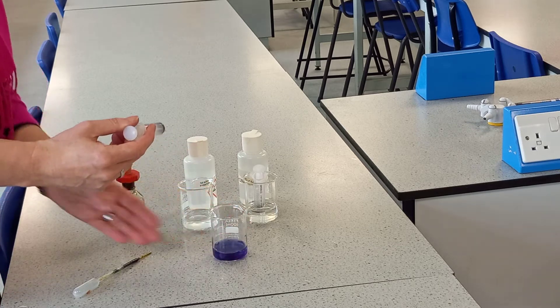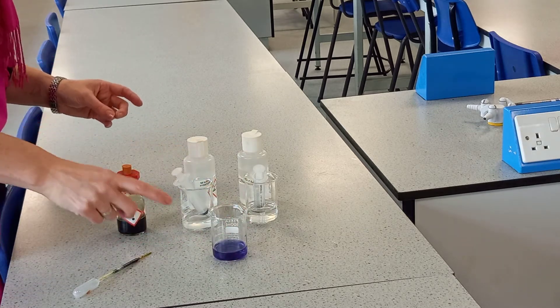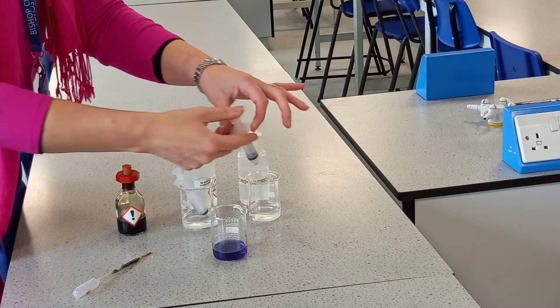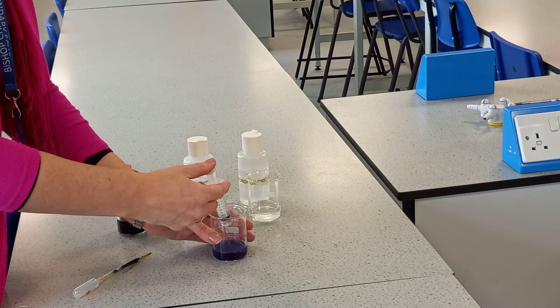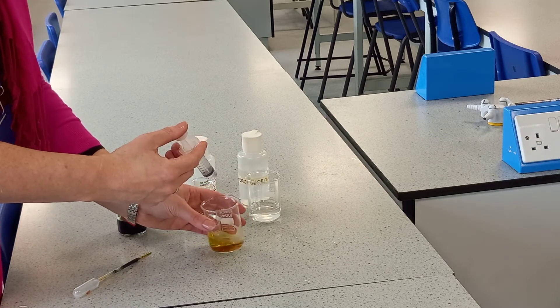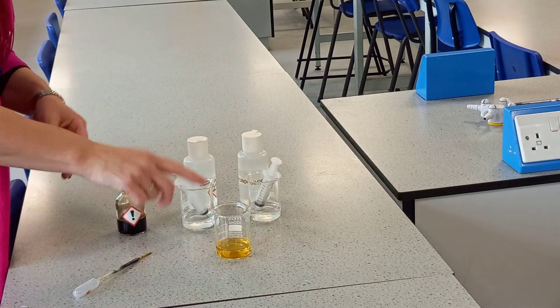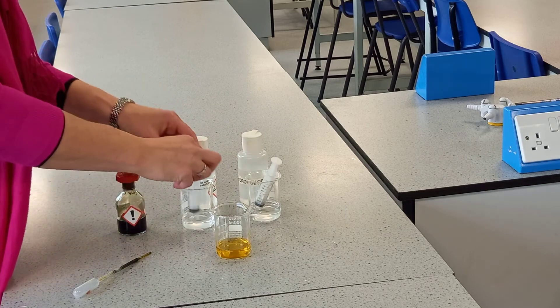Here I've added slightly too much sodium hydroxide, so I will need to add a little bit more hydrochloric acid in order to make it neutral. There I've now gone yellow, which is again slightly too far.